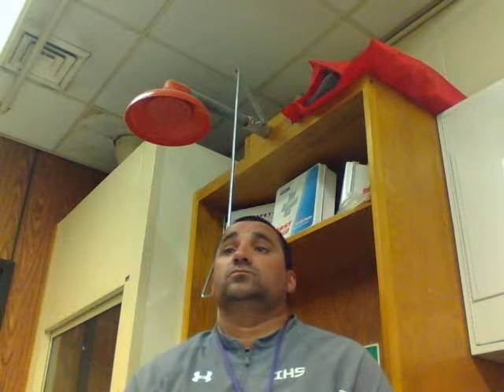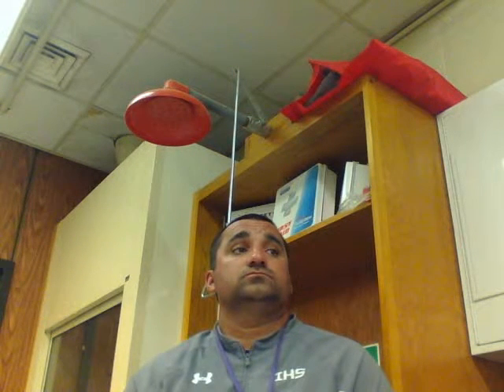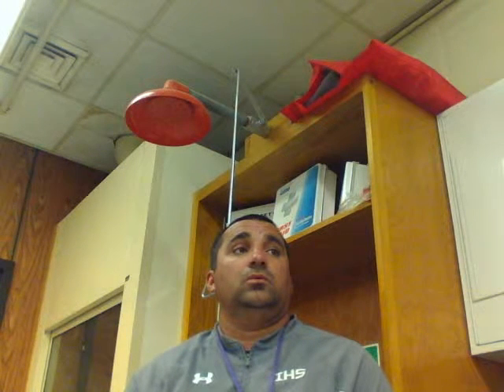Alright, so your objectives are where? Where are your objectives on this? That's these, right? These are your objectives. So first off, we need to find out how much they magnify. They have a little number on top of the little infinity sign.